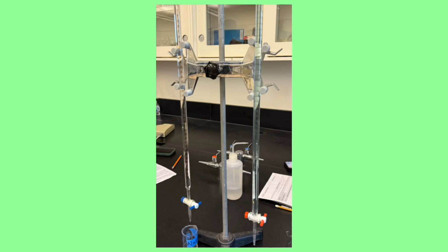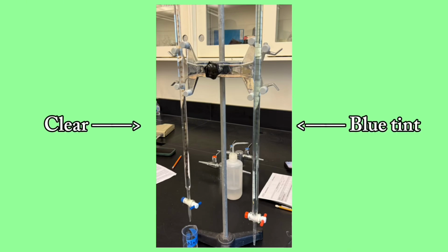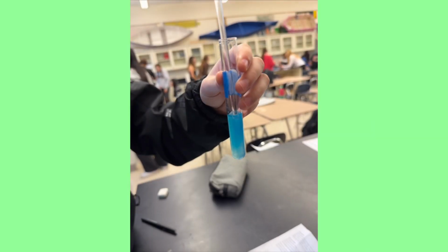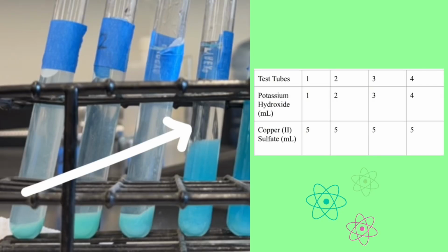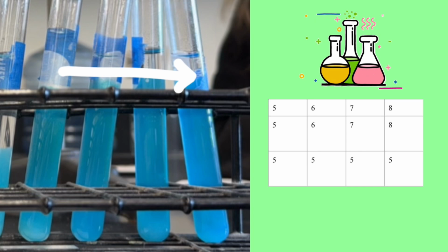Before we even started, the copper(II) sulfate solution had a distinct blue tint, while potassium hydroxide was completely clear. When we started mixing, the solution turned cloudy. In test tubes 1 through 4, the precipitate increased in height as more potassium hydroxide was added, appearing baby blue with a soft, powdery texture. In test tubes 5 through 8, the precipitate plateaued despite additional potassium hydroxide, developing a deeper blue, translucent, glass-like appearance.